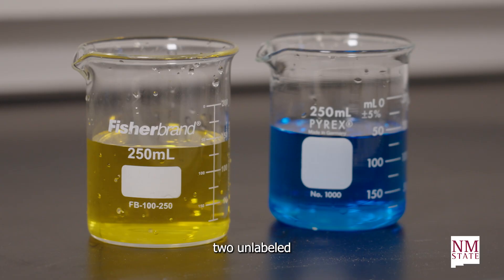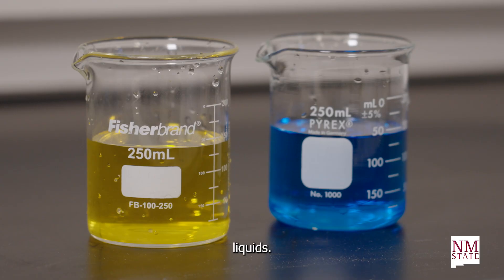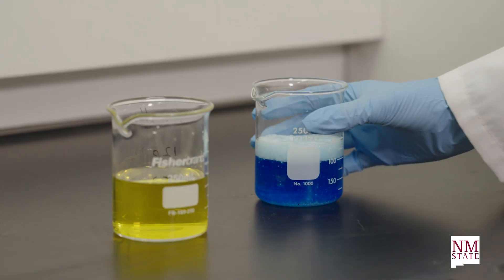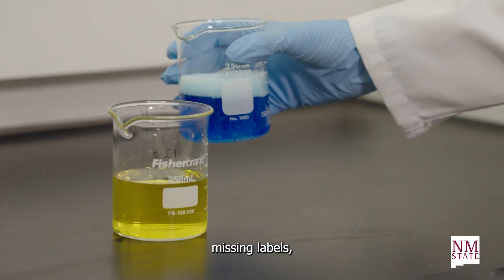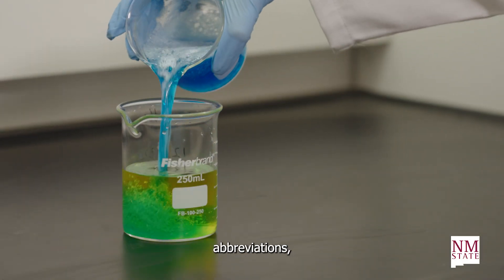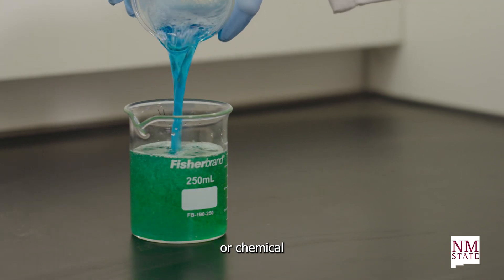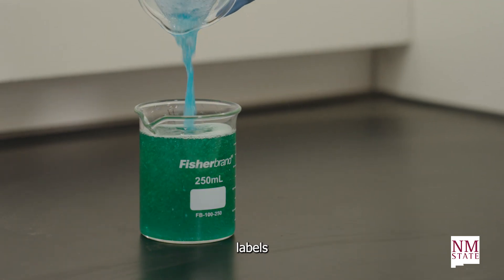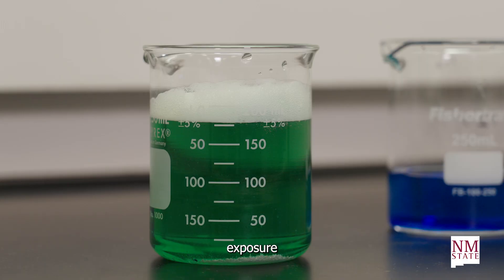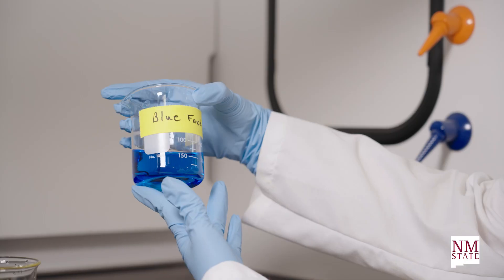Right now, you are looking at two unlabeled liquids. Unclear labels, missing labels, and the use of abbreviations, formulas, or chemical structures on labels can lead to potential exposure to hazardous chemicals.